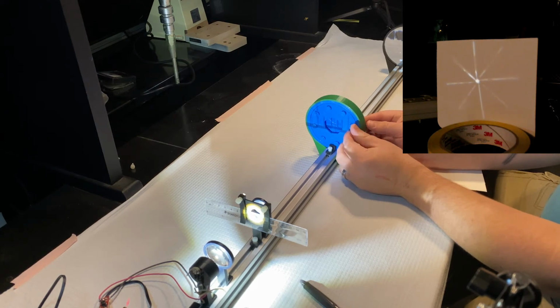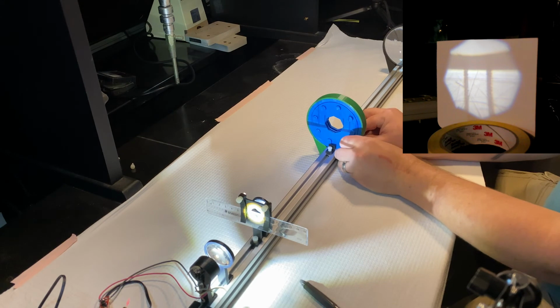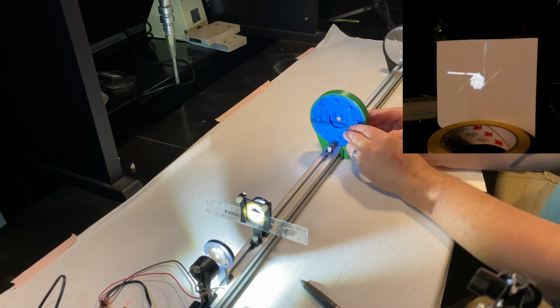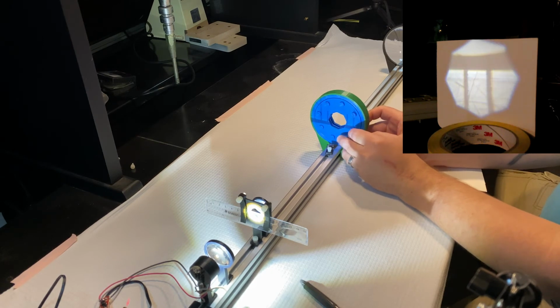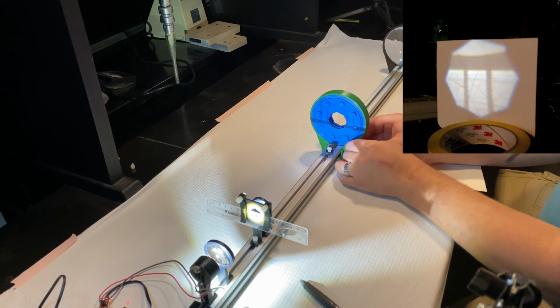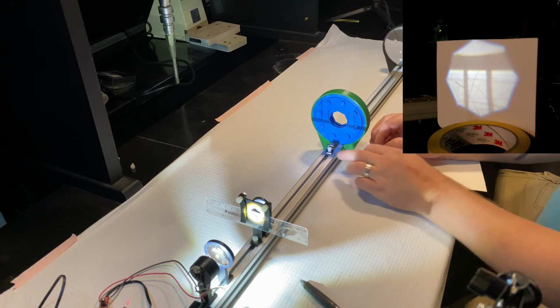What does it look like? Now if you want, pause the video and go back and look at what the iris looked like before I mounted it, because I can't easily take it off and show you here. But that shape there should be pretty familiar to you. It's actually the iris opening and closing. Those little triangles are the teeth. So that's fully open, that's fully closed. So this is what happens when you have mounted your iris in your conjugate image plane.